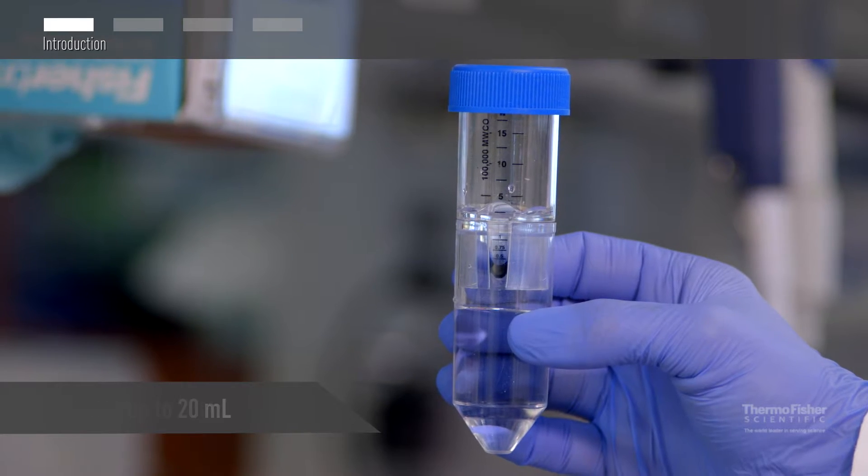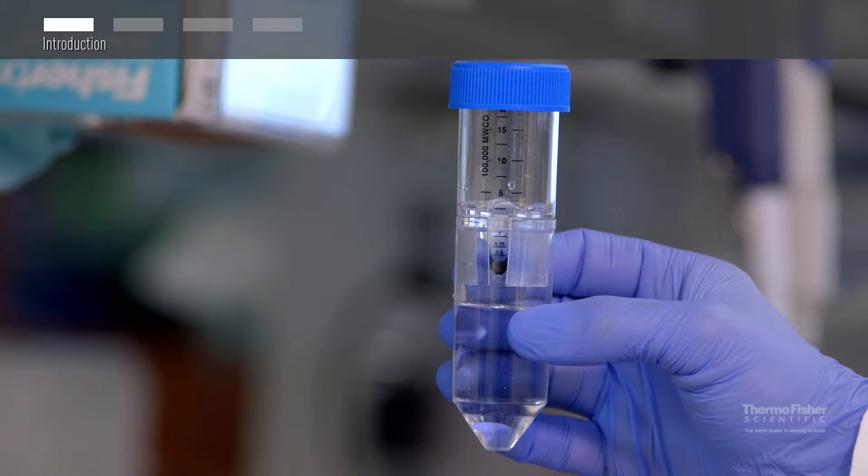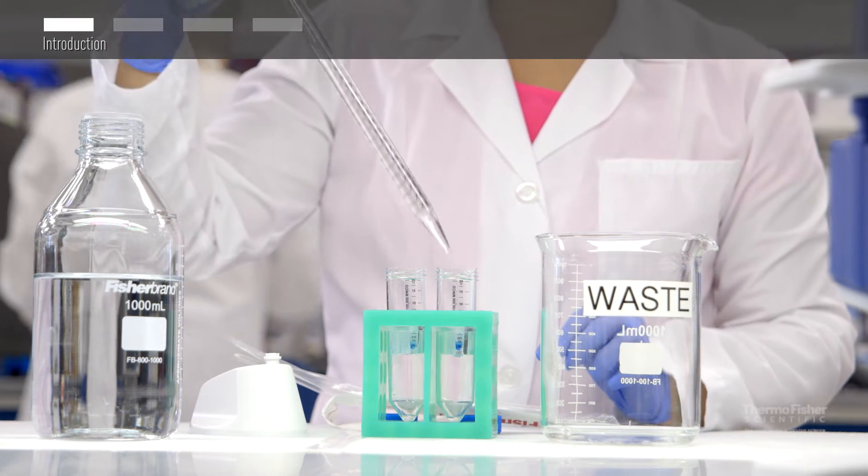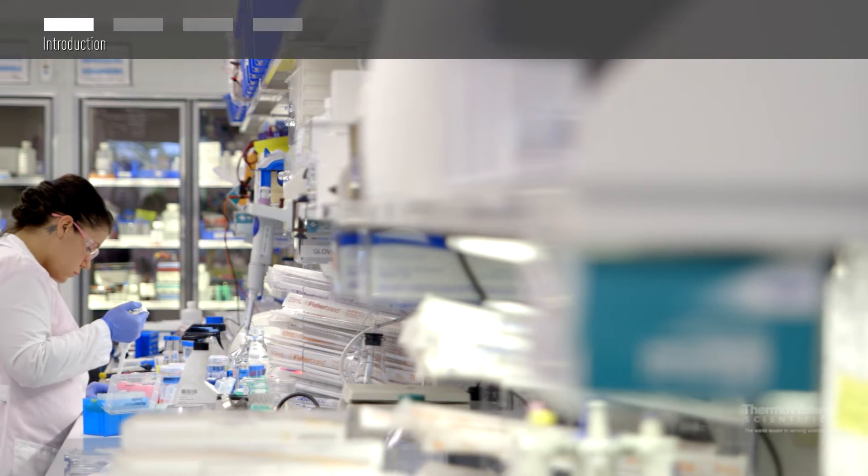Do you want to desalt or buffer exchange your protein too? Not a problem. The Pierce protein concentrators will simultaneously concentrate your protein while removing salts, allowing for easy transfer to a new buffer.